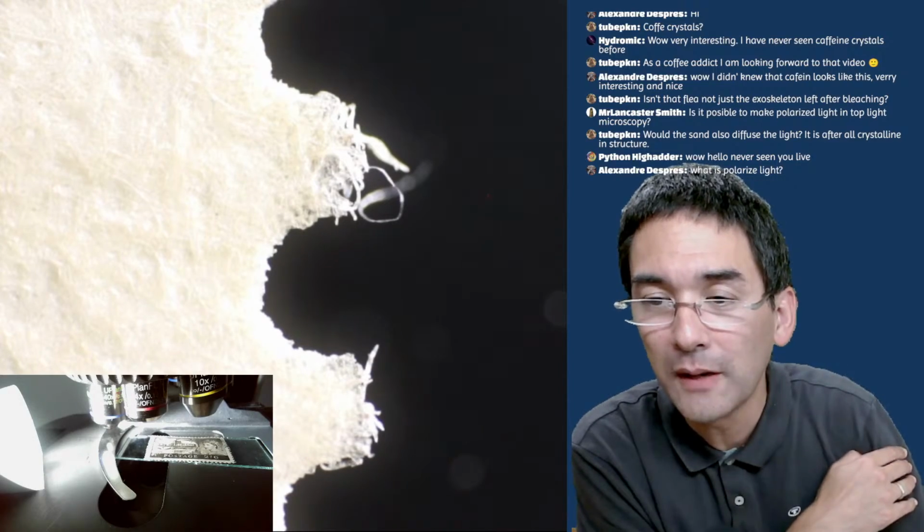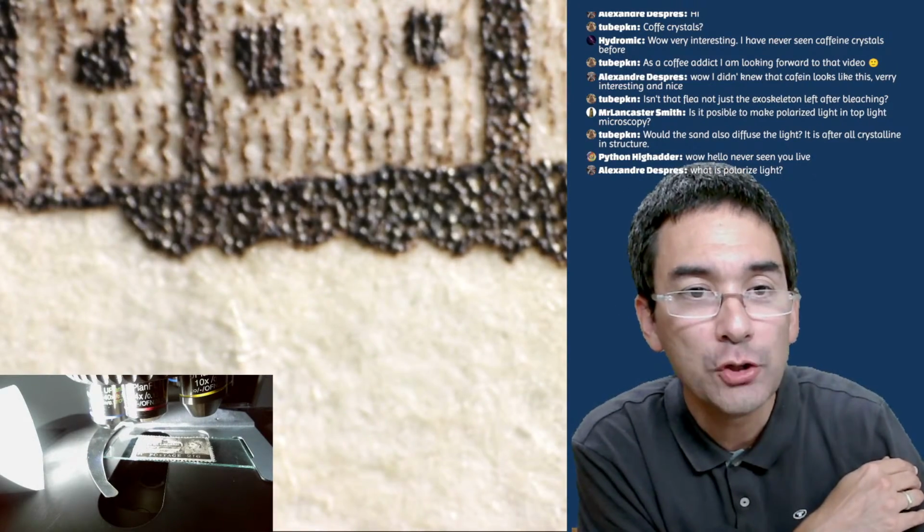So what is polarized light? This was also a question. Okay, short explanation.